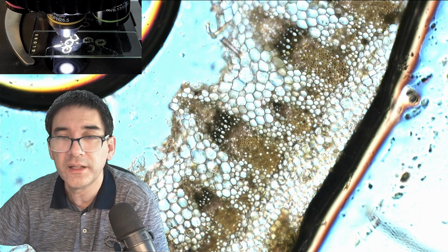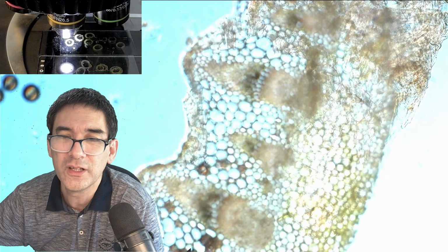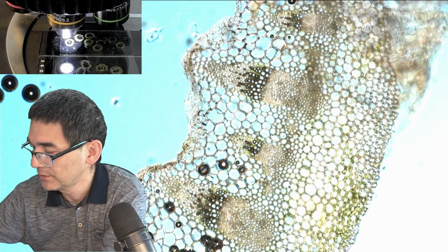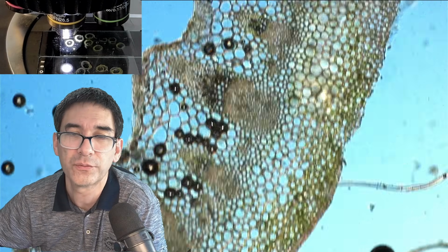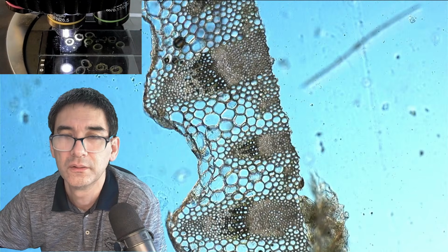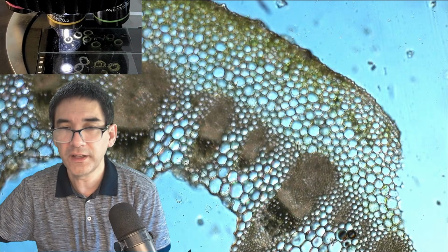Yeah, I think you get the idea in comparison again to the one that I had before, the freshly cut one. Look at this. It actually looks even thinner, this one over here. Let's go down. I think I'm just going to stay with the freshly cut one. Yeah, looks nice. I'm generally overall satisfied.